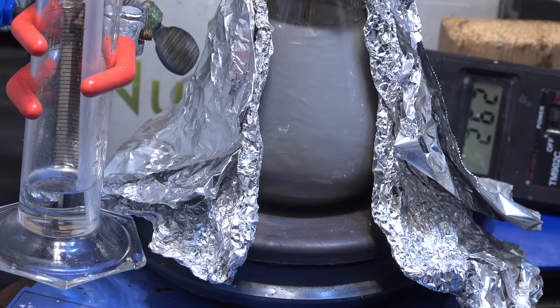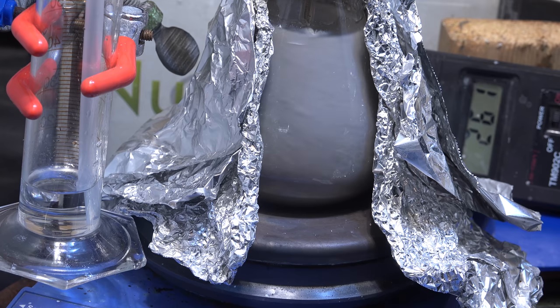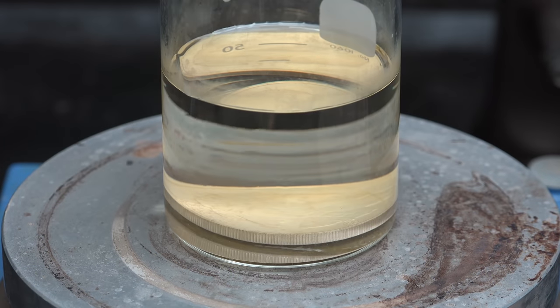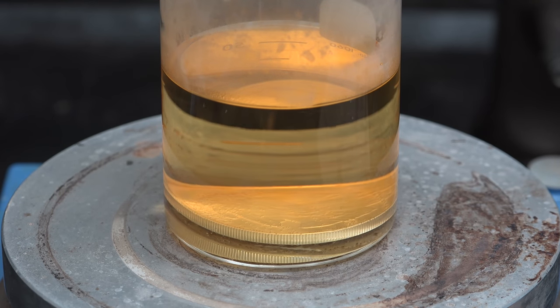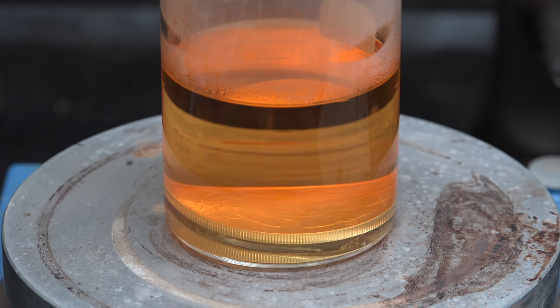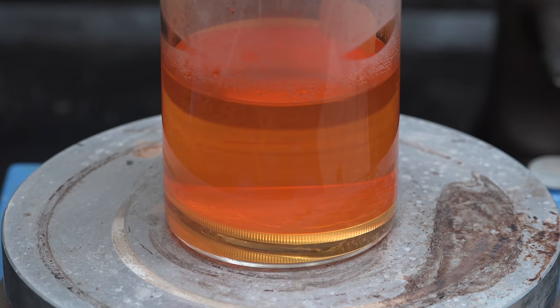I think I'll abandon lithium metal until further notice and attempt the metal production experiments on potassium. Hopefully our new understanding along with our advanced catalysts will work much better. Anyway, in a completely separate line of experiments, I've been going back to doing some very simple chemistry, like dissolving silver in nitric acid. I think after several months of doing novel scientific research, it would be a welcome change of pace to do fun chemistry again.